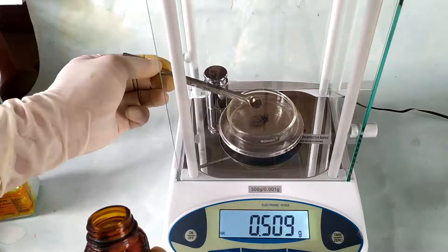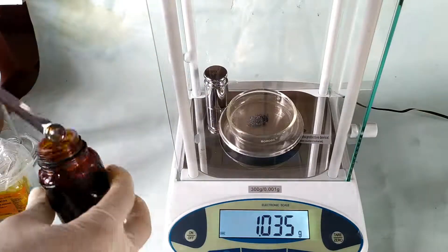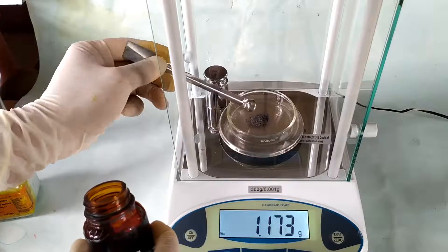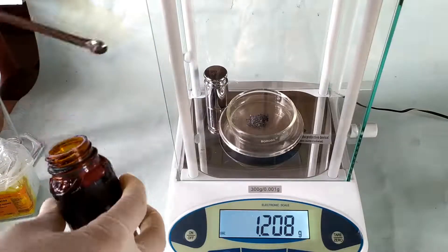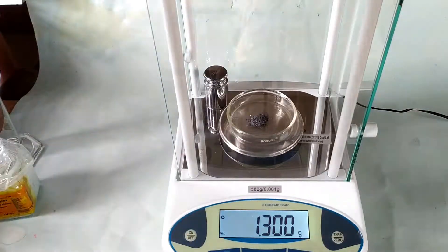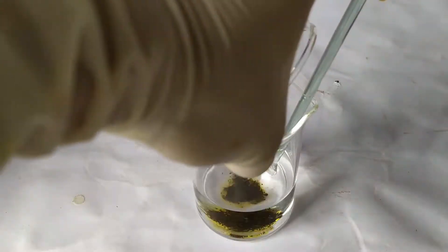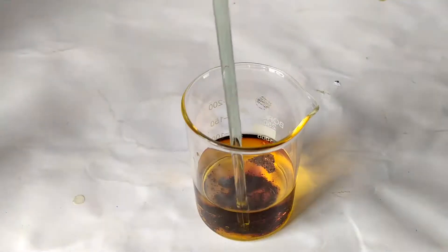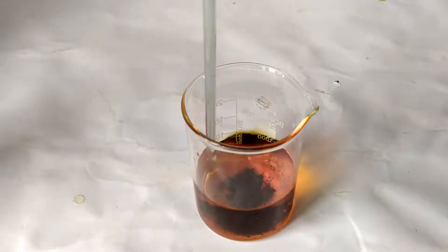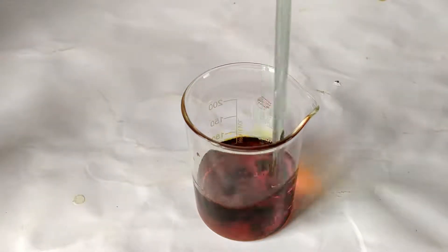Now weigh approximately 1.3 grams of resublimed elemental iodine crystals. Carefully transfer this into the potassium iodide solution in the beaker, and stir to completely dissolve the iodine. This will take some time.